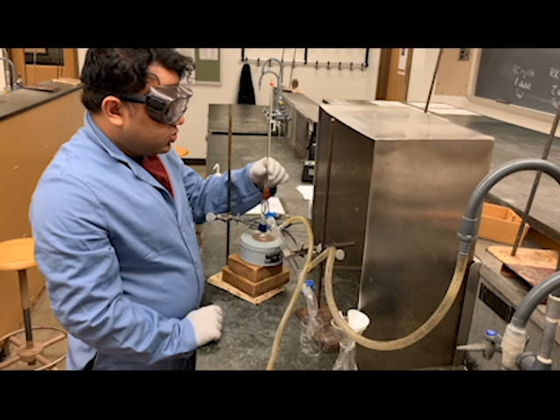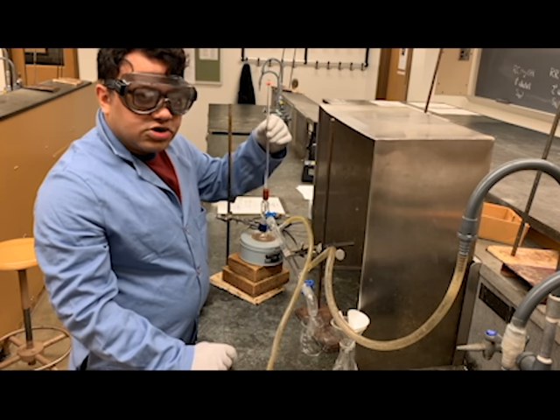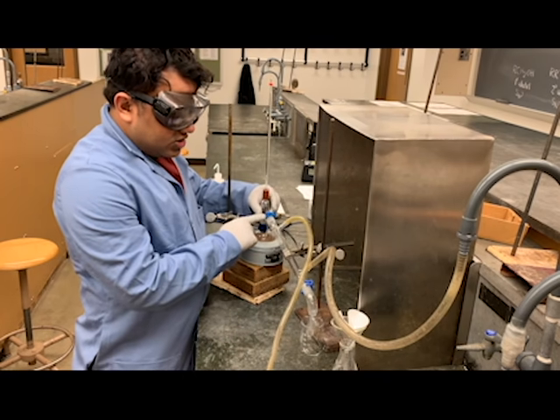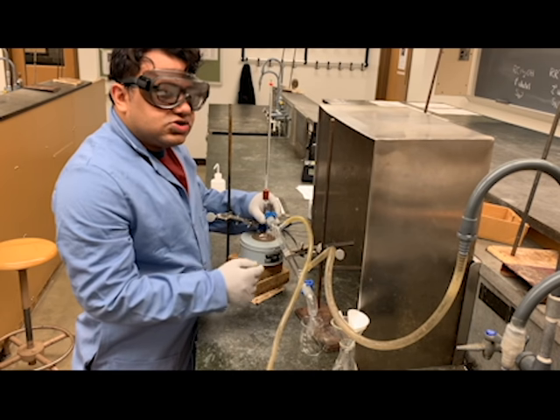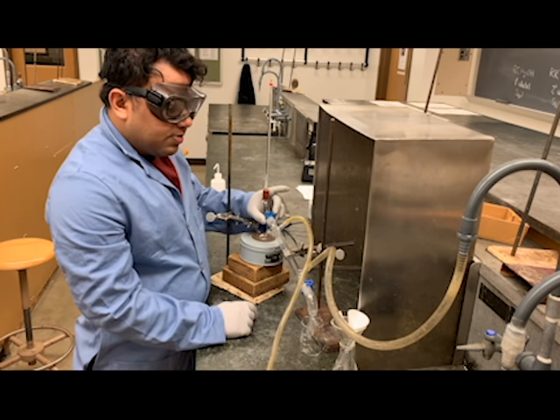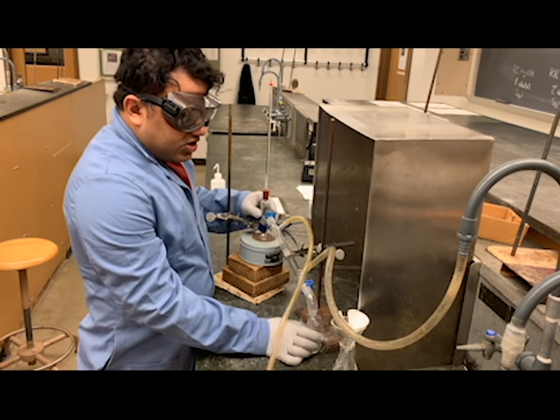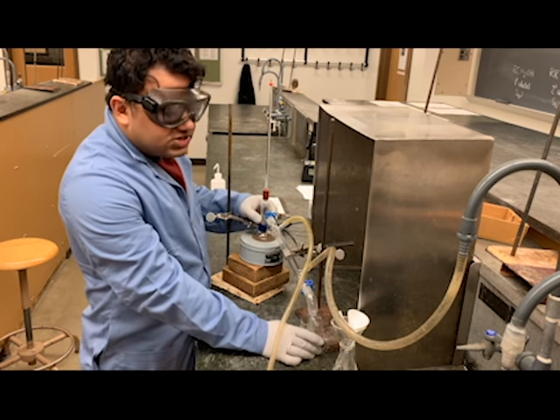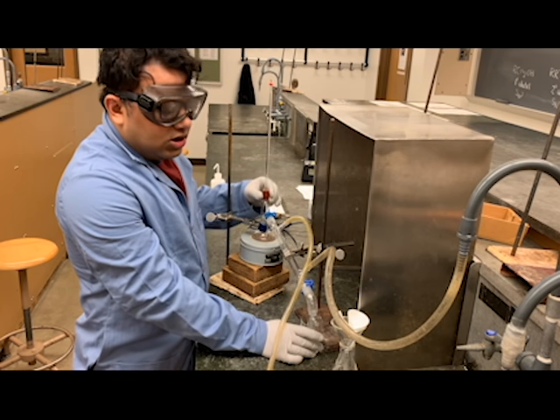On the top we are putting in our thermometer with the red fitment to hold it, and the outlet in the middle we're connecting to our condenser, putting a keck clamp on both sides. We have our receiver end, and for the first 10 drops from the receiver we are going to collect them in a beaker.